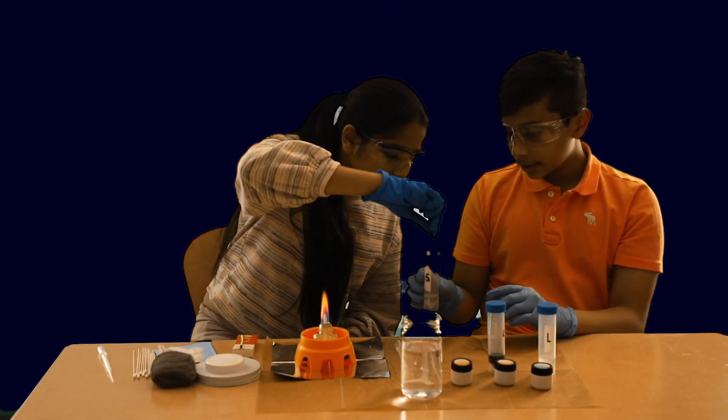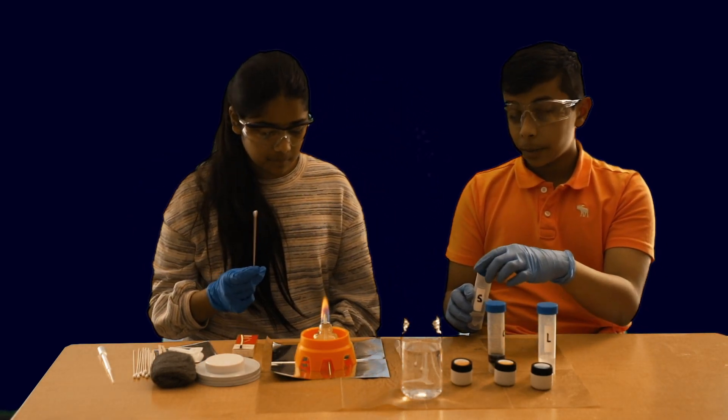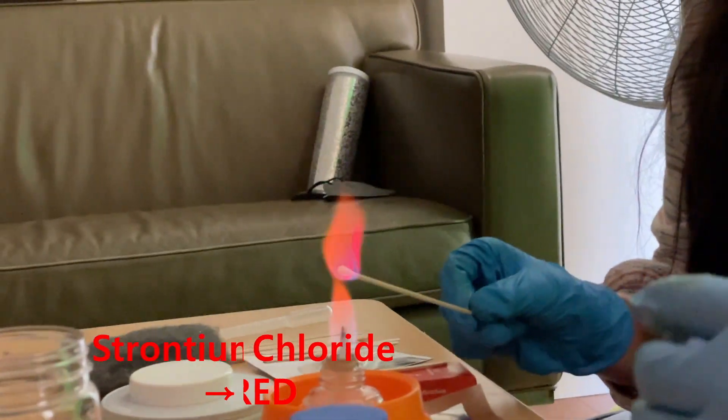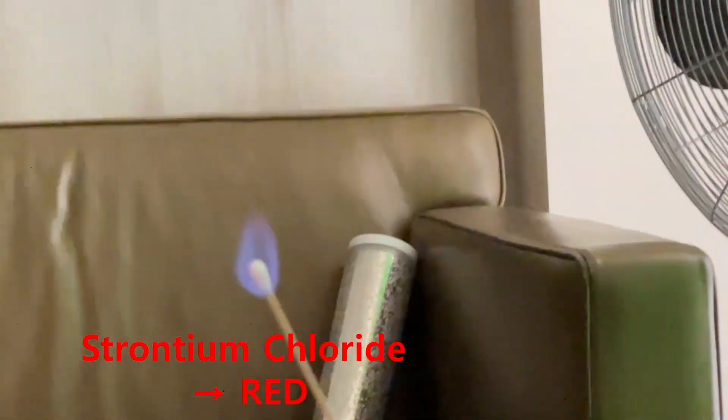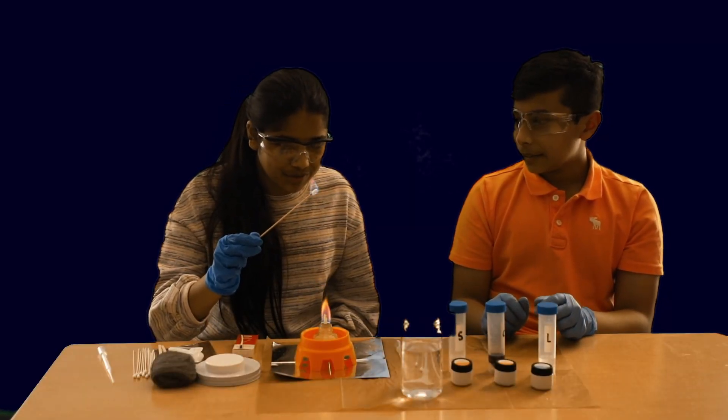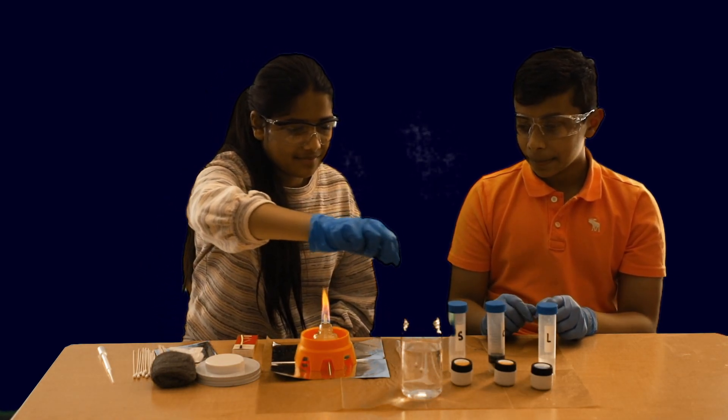Dip it in here. And, yeah. So, we're going to put it in the fire and see what's the outcome. Whoa. Wow. That's such a cool hot pink color and it's turning blue. It's like blue and red. That's so pretty. I know. That's so cool.